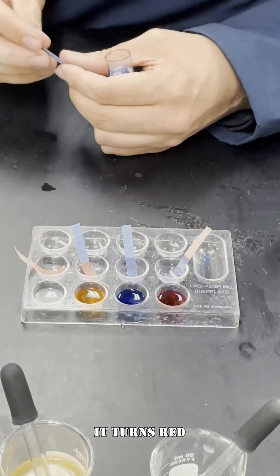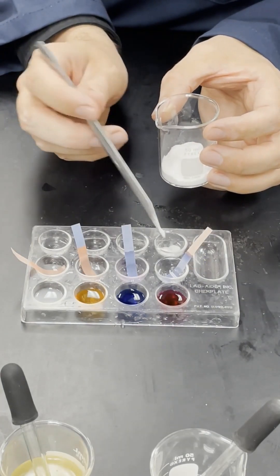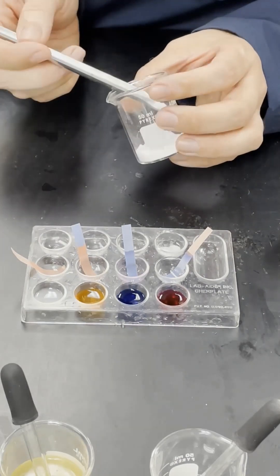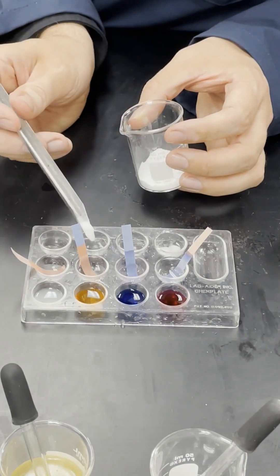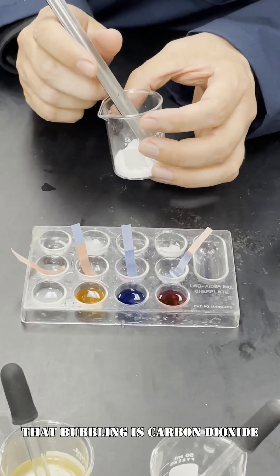Now carbonates, when placed into a base, nothing's really happening there. But when placed into an acid, they fizz. That bubbling is carbon dioxide.